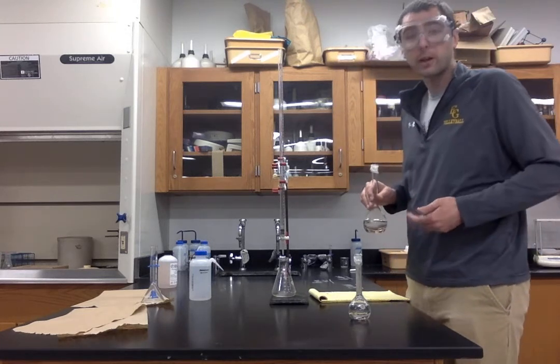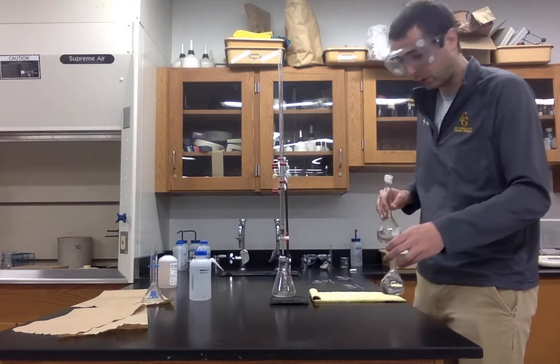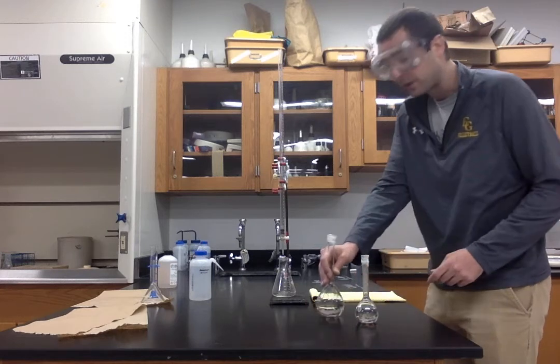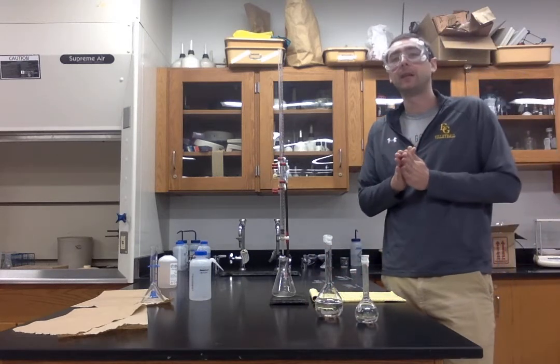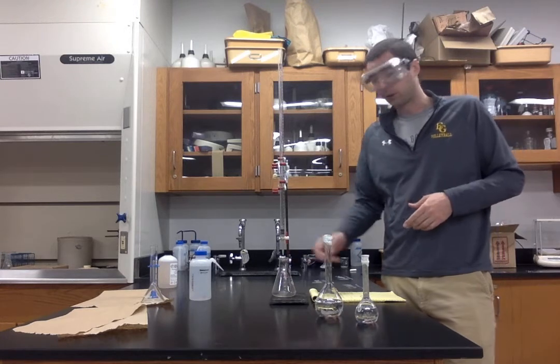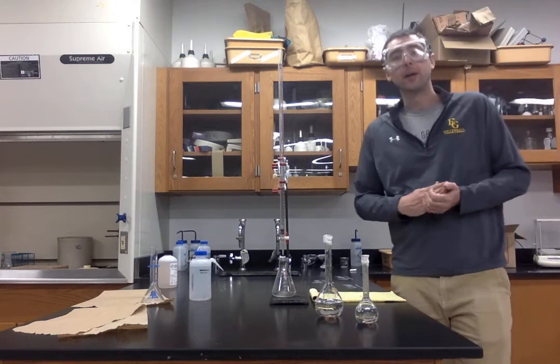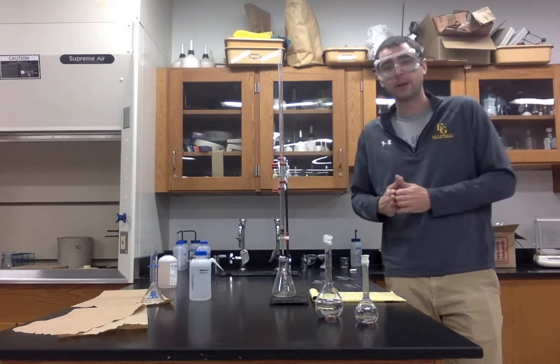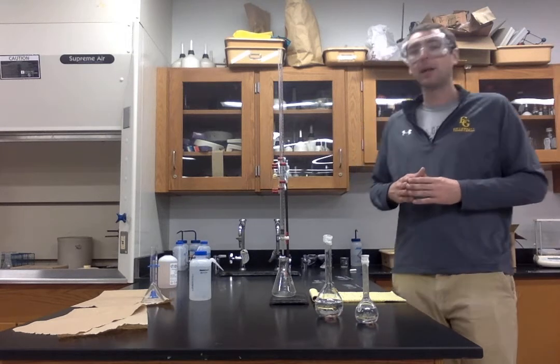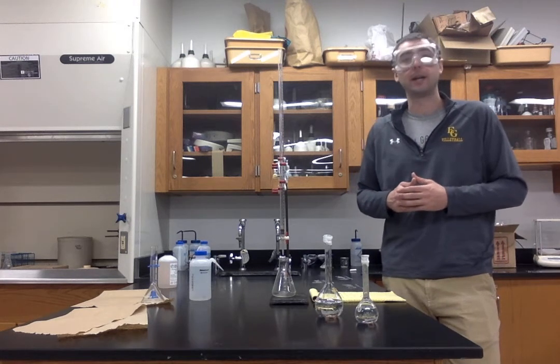Now, first we're going to titrate our acid to determine the concentration of our acid, and then after we know the concentration of our acid, we'll be able to work backwards and figure out the pH of our solution at multiple points along our titration curve. Now, before we actually get started on the lab here, I want you to pause the video for a brief second and jot down the acid-base neutralization reaction that would occur between HCl and NaOH.